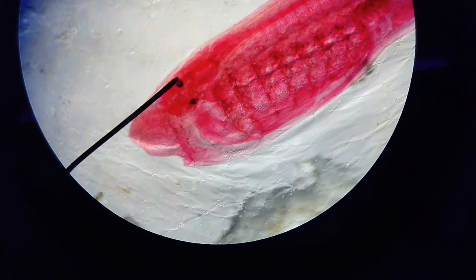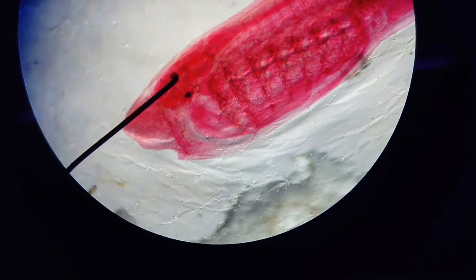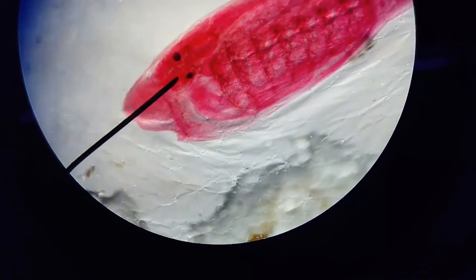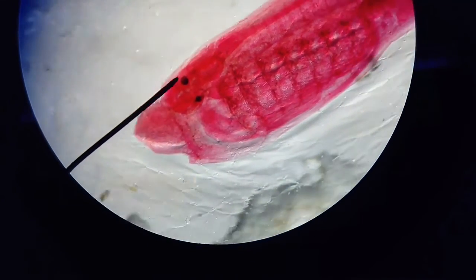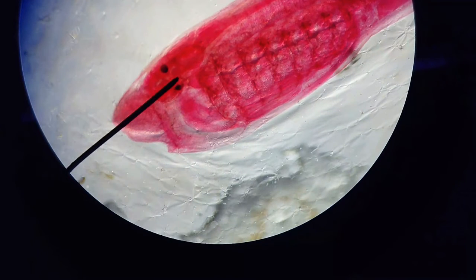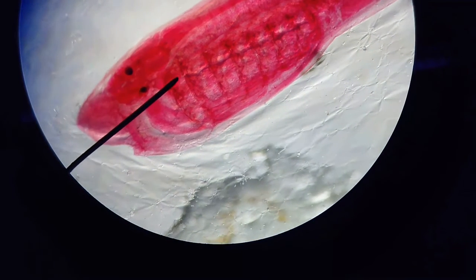And a lamprey is a vertebrate, not just an invertebrate chordate, which means it will have all of the vertebrate characteristics at some point in its life, but you can't see all of those in the larval form. But the way you can distinguish these two apart, a big one is if you look right here, that is where the cranium will form in its adult form, and that will house the brain.